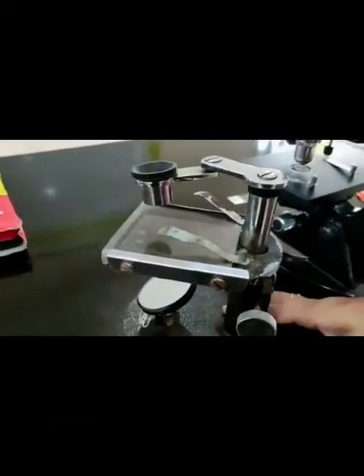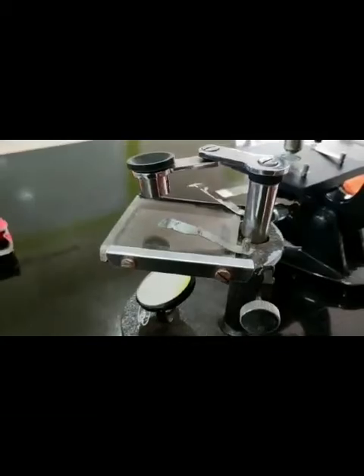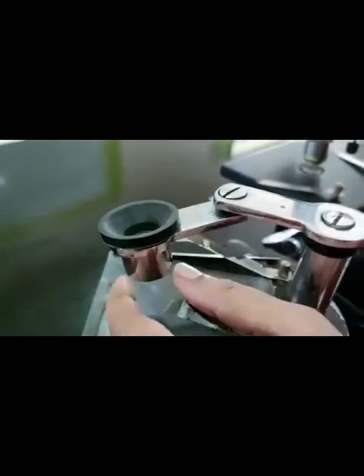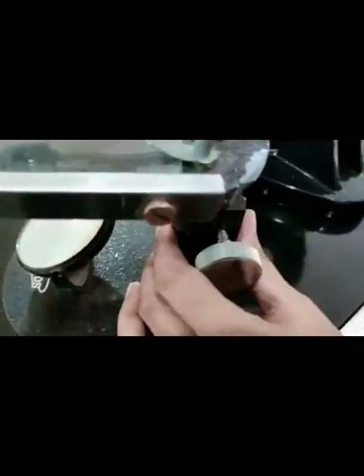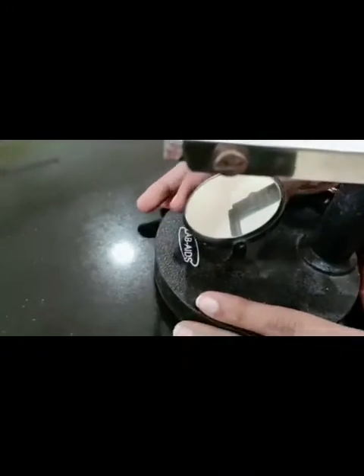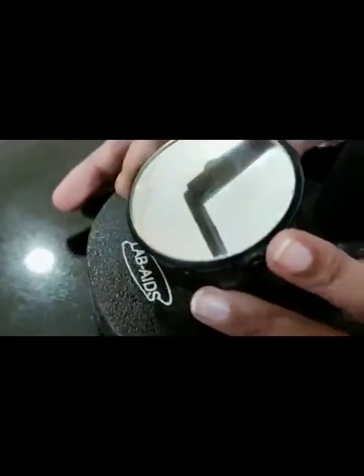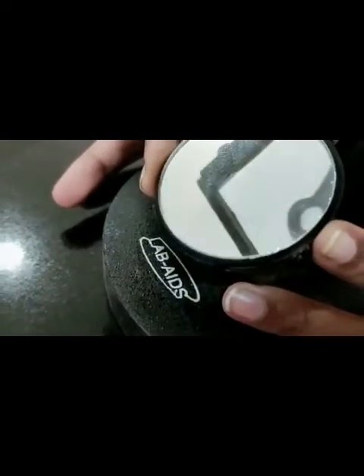First we will see the different parts of the simple microscope. As you can see, this is a simple microscope. It has different parts: this is called the glass stage, this is the vertical limb, this is the simple convex lens, this is the stem or the stand, this is called the foot of the microscope, and here we have the mirror — a type of reflecting glass mirror.